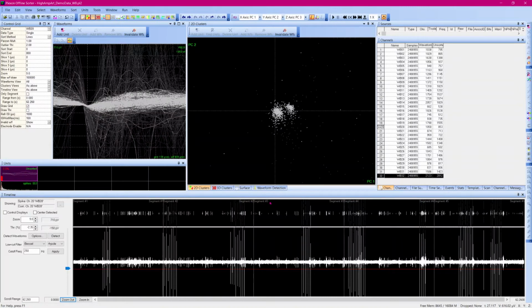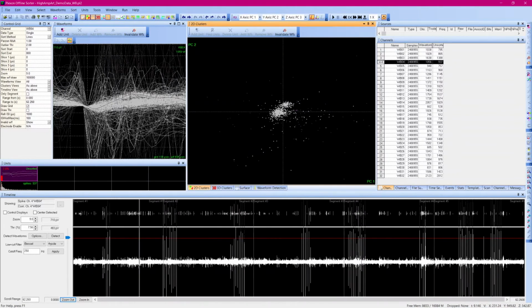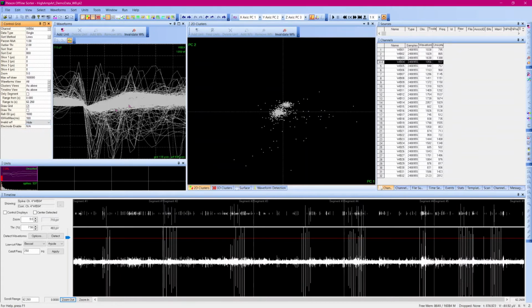After applying this tool, many waveforms become a darker gray. These are the invalidated waveforms that were classified as artifacts. We can also see the clusters were recalculated and that there is indeed a spike unit on this channel. In the control grid by Invalid Waveforms, you can hide the invalidated waveforms. Now it is very easy to see that there is a unit in the waveforms view, but that we didn't remove all the artifact waveforms. To see which waveforms were removed, and importantly, which were not, I'm going to view the invalidated waveforms.